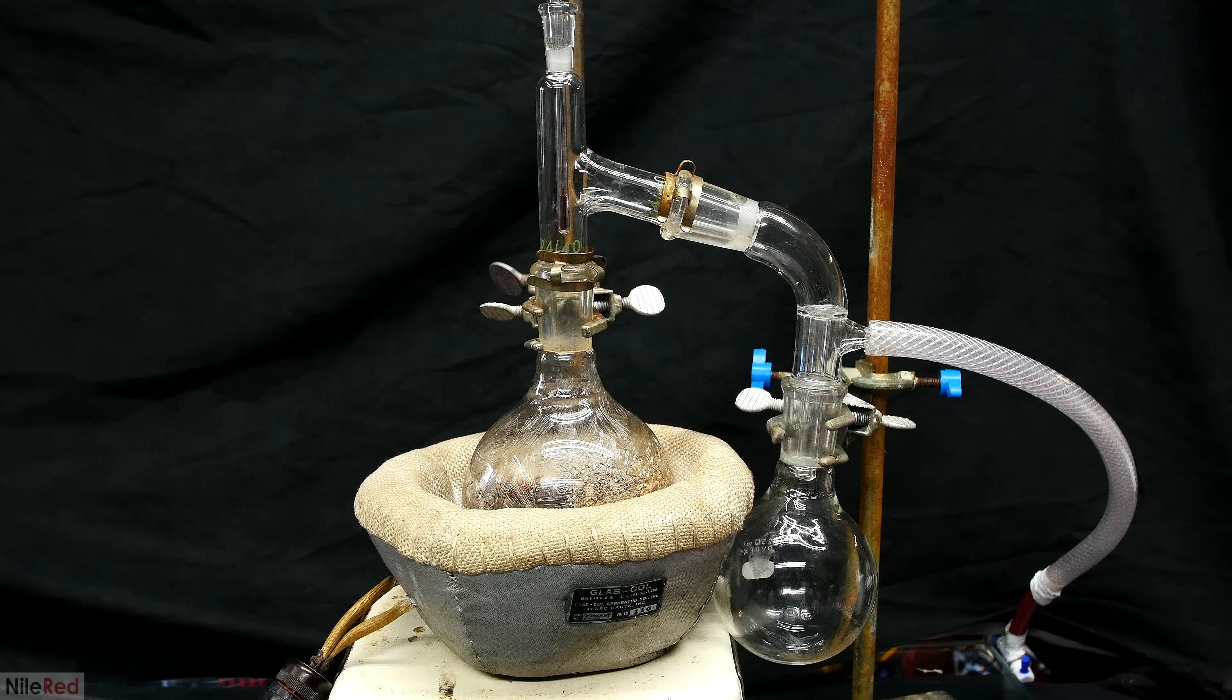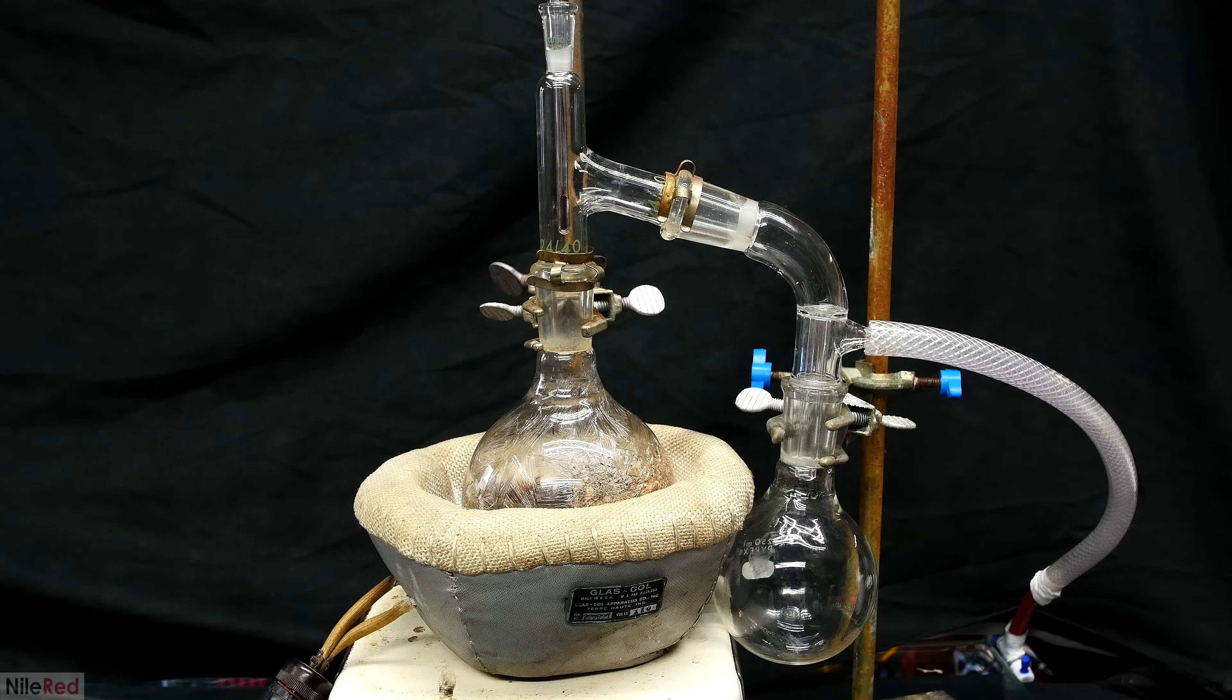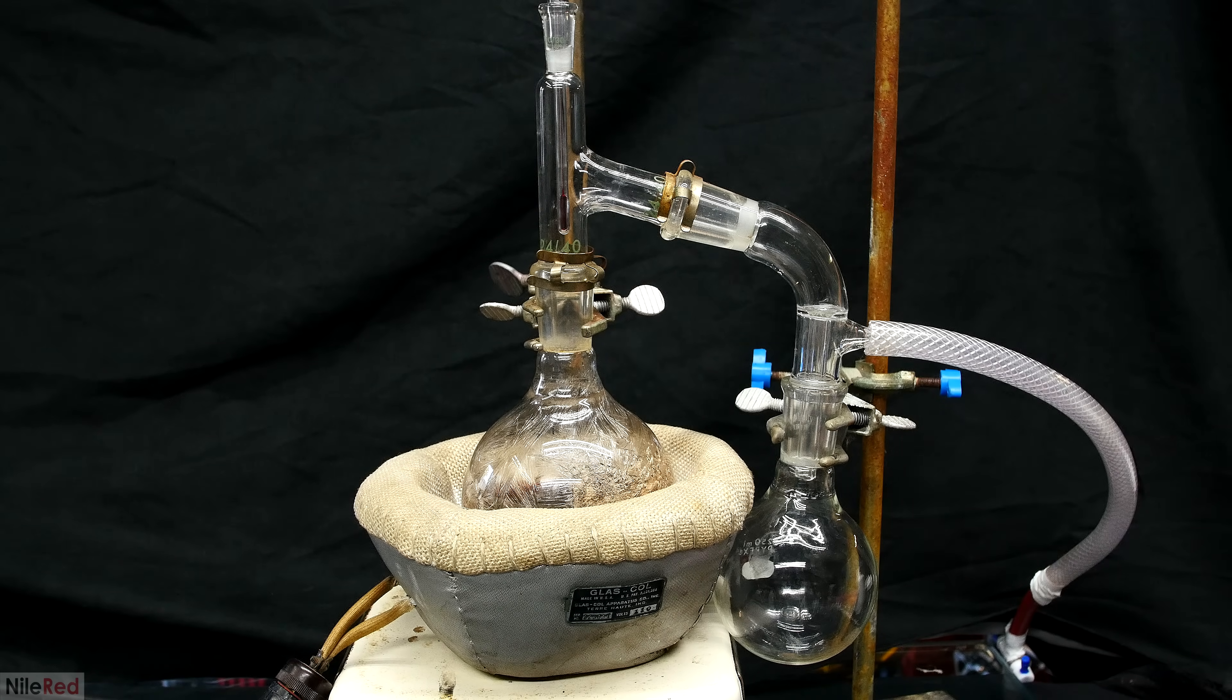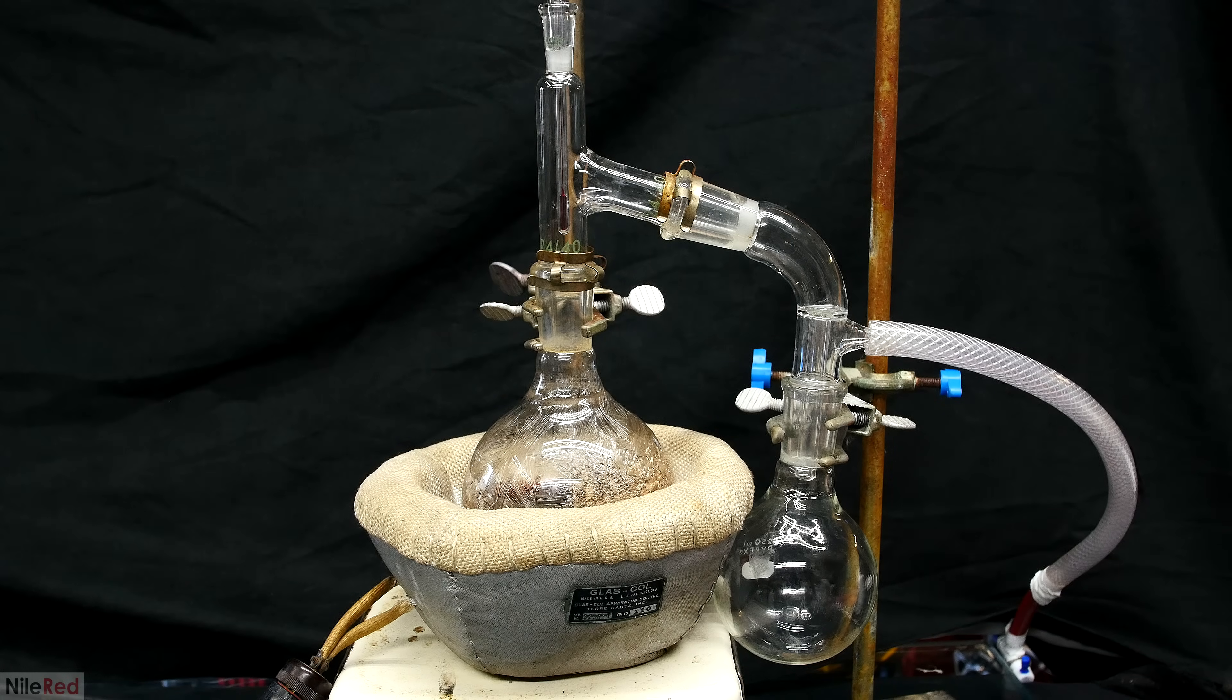I do have a feeling though that it's possible to distill it without a vacuum, but I've never really tried this, so I can't really comment on the purity or the quality that you'll get out of it.